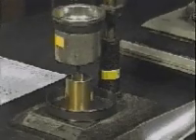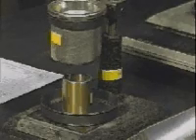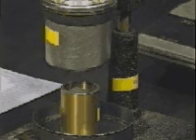If necessary, it may be agitated or pushed by use of a length of wire, but care must be taken to prevent the wire from entering the density cup. The density cup should not be moved during the filling operation.